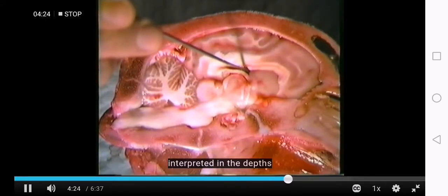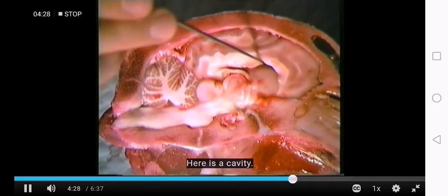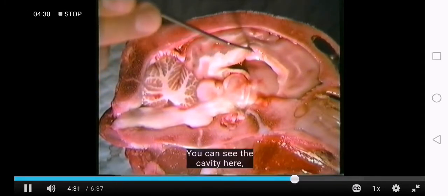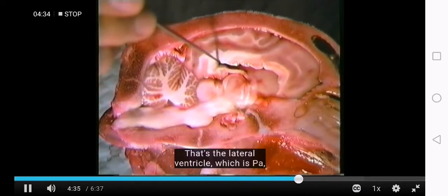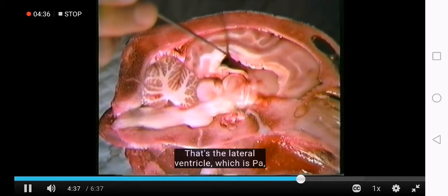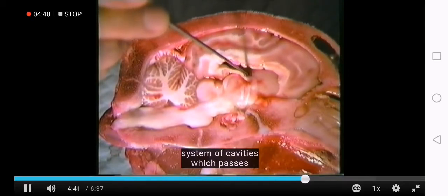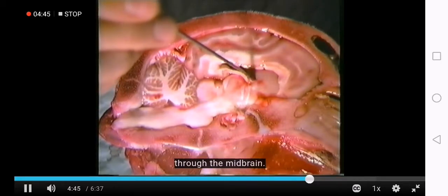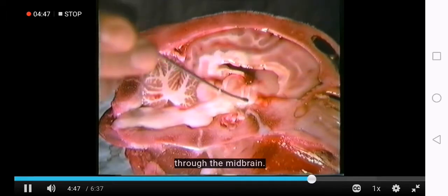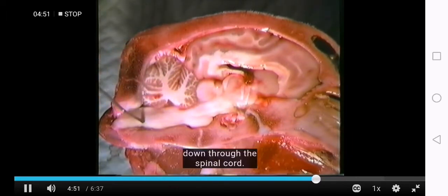In the depths of the cerebral hemispheres here is a cavity. You can see the cavity here, which goes deep into here. That's the lateral ventricle, which is part of a system of cavities which passes through from the cerebral hemispheres through the midbrain, down through the brainstem, and down through into the spinal cord.